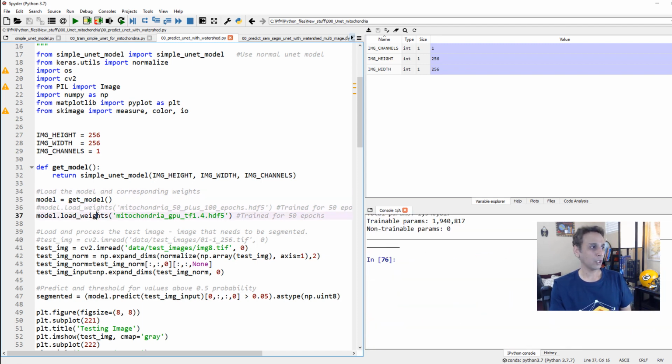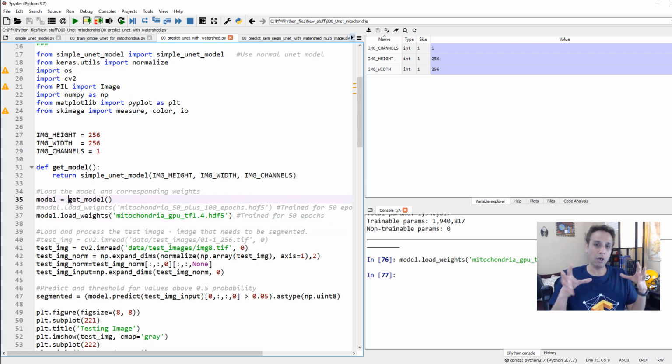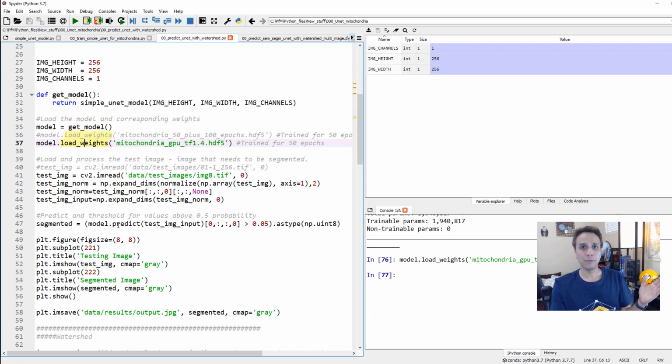Now that we have this, I can go ahead and load the weights. It'll tell me that I'm trying to load weights for a model that's not the same architecture as what I trained on, but obviously I know this is what I trained on, so it should be fine. So now I loaded the weights. Initially, you loaded the bare model, and now you're assigning weights to each of these, about 1.9 million parameters that we trained. And now I'm set to predict. Once you have a trained model, implementing it is so simple. You just take the trained model, load it, and then go ahead and load your images.